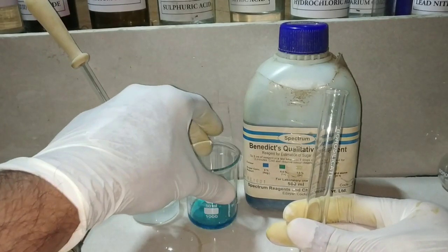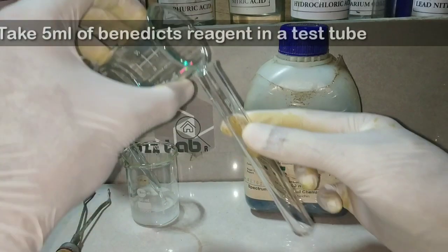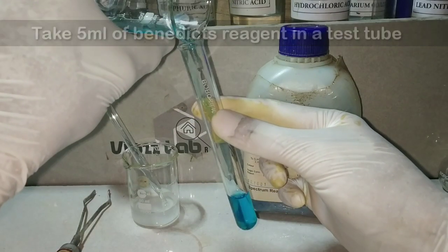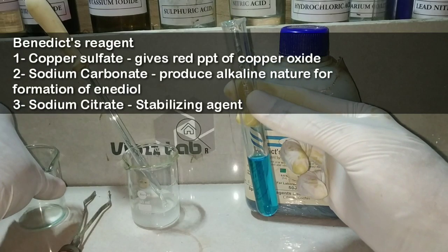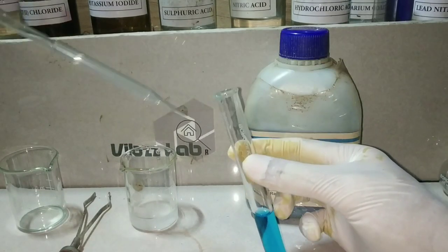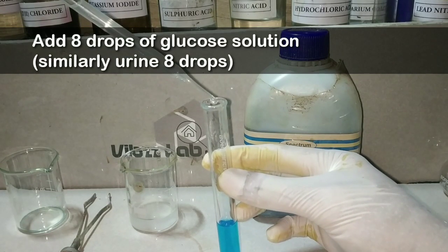First of all, we will take a test tube into which we will be adding 5 ml of the Benedict's reagent. You can see that Benedict's reagent has a blue color because of the presence of copper sulfate in it. The components of Benedict's reagent are copper sulfate, sodium citrate, and sodium carbonate.